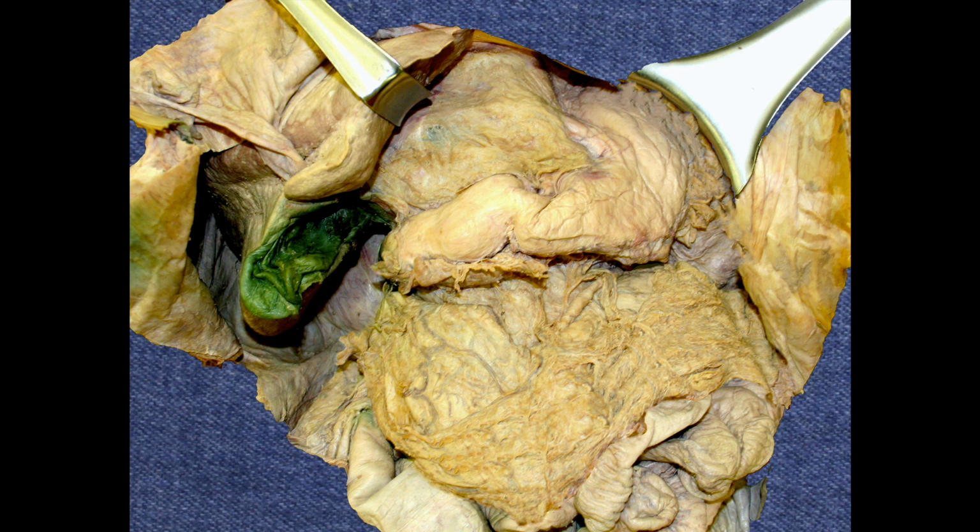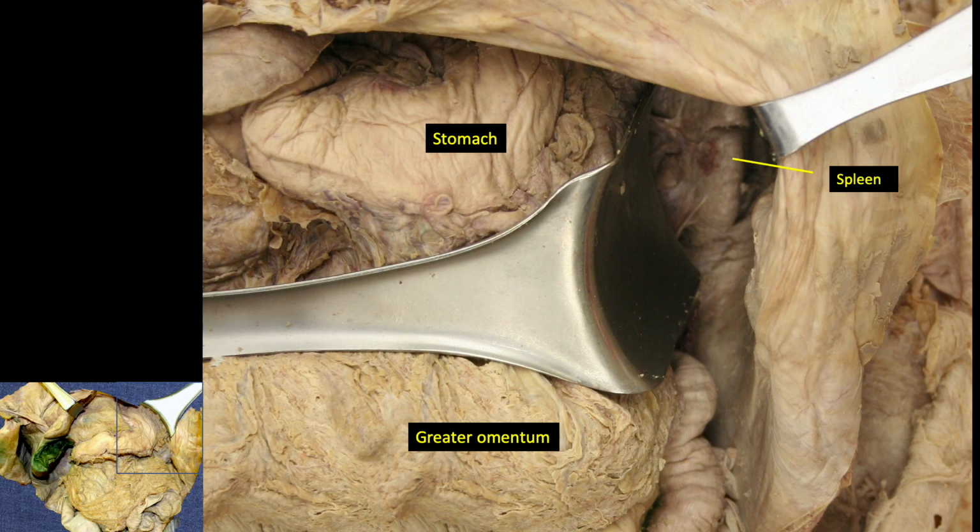Moving to the left side of the abdomen, reflecting the stomach to the right and raising it some, we can now barely make out the spleen in the upper left quadrant. Students in lab often cannot find this structure without the help of the instructor because it is so deeply located and because it is also partially hidden by the lower ribs. In a separate video, we will get a much better look of this organ and also demonstrate its blood supply.